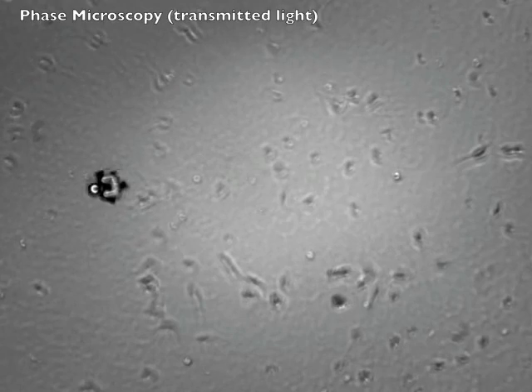In this task, we deliver drug-loaded microbeads to a chosen destination on an individual neuron. This capability enables us to stimulate individual cells at different positions. We may load individual beads with one or several chemicals, and we may stimulate cells at different locations.